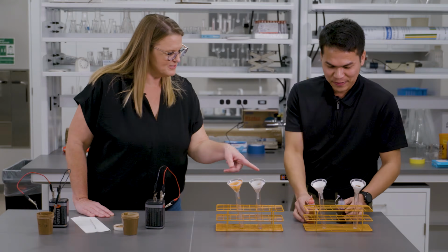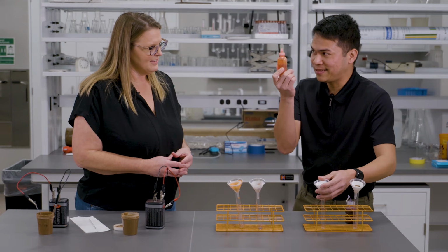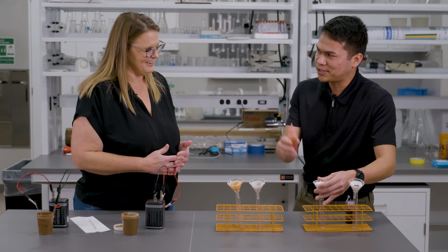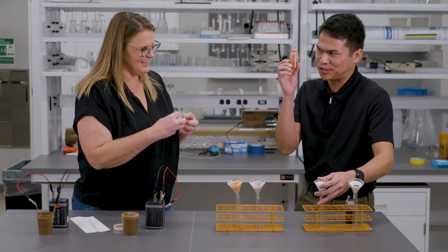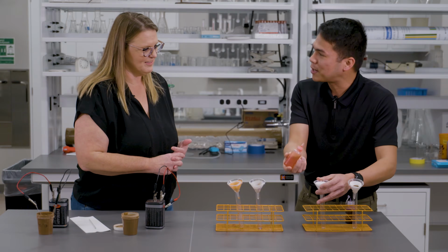All right. So we're going to do the same with the opposite color. We'll do the same thing using red dye, which again bears a negative charge, so it should just go right through. If this one bears negative charge and the soil has negative charge, what will happen to the leachate? Will it be clear or just the same? It's going to be repelled, so I would say it's going to be red. It's going to be the same thing. So that's our hypothesis.